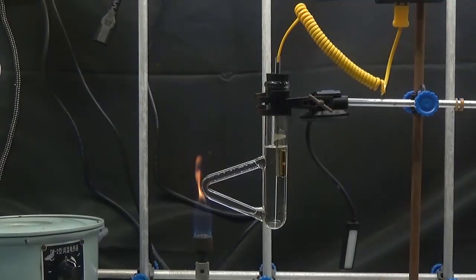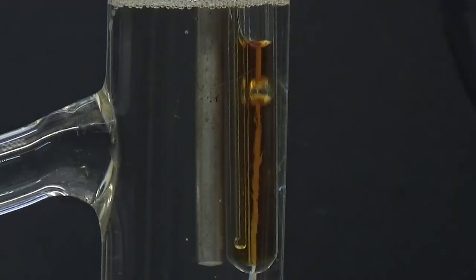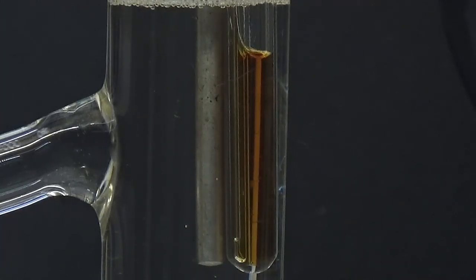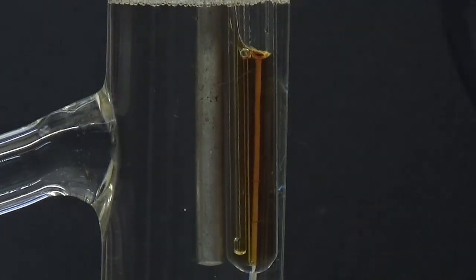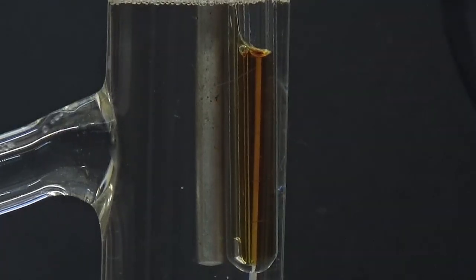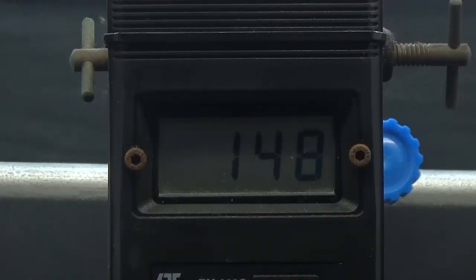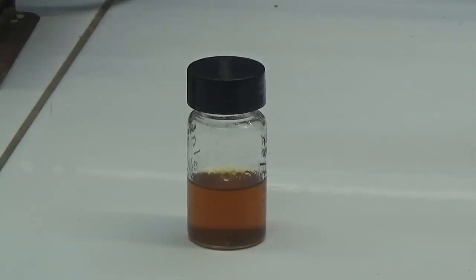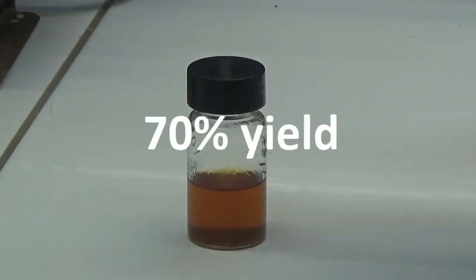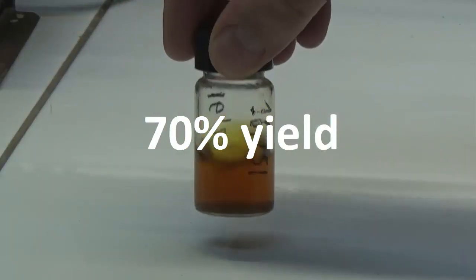The boiling point was 147 degrees Celsius, very close to the theoretical boiling point of 145 degrees Celsius. The yield for this operation was 70% furfurylamine.